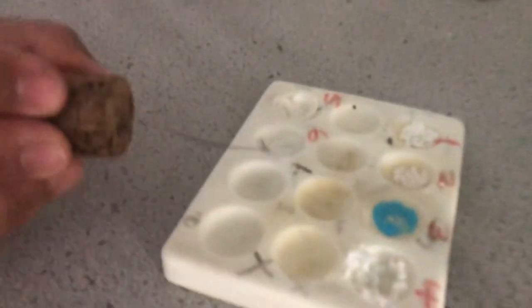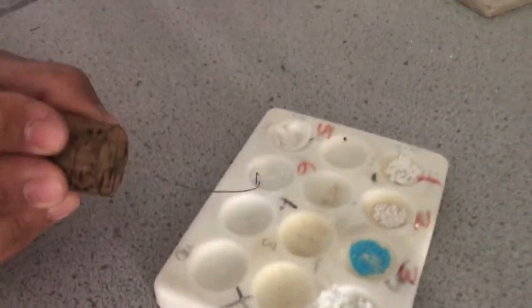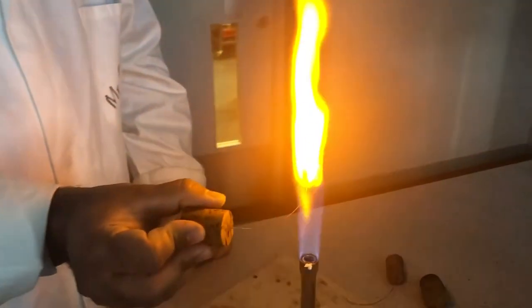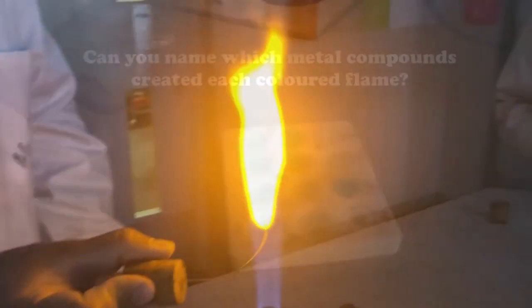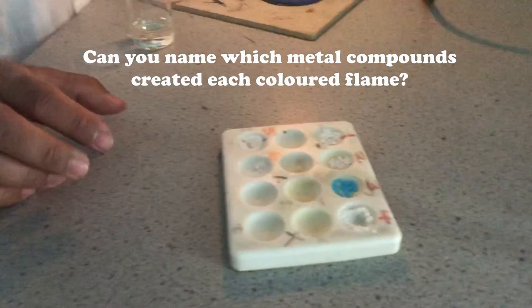And that's for the final one. It's giving us an orange color.